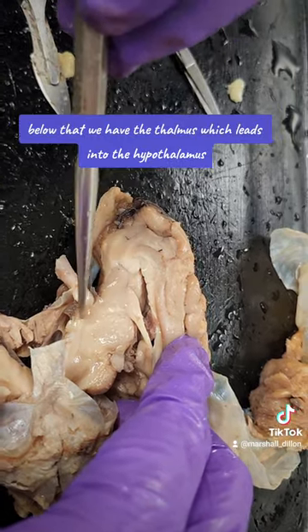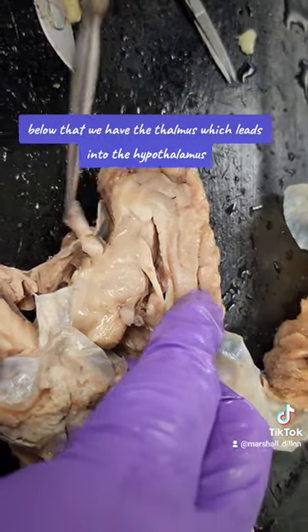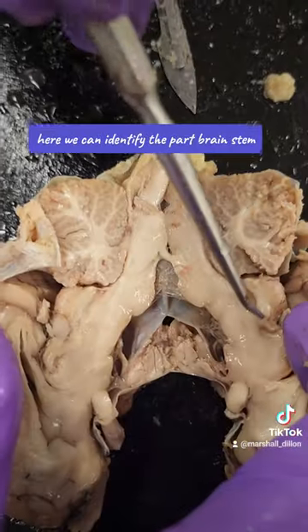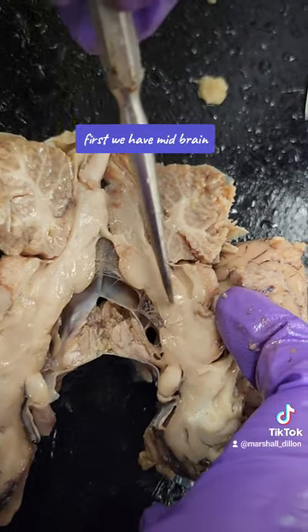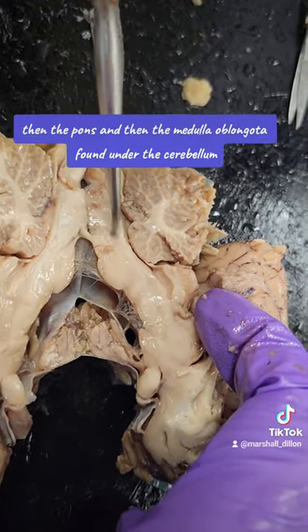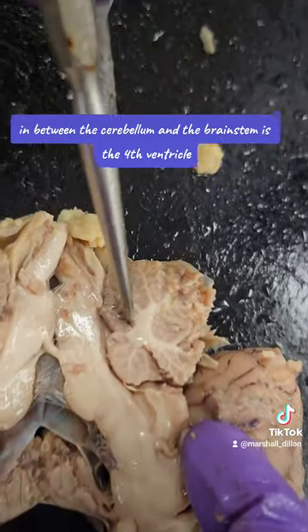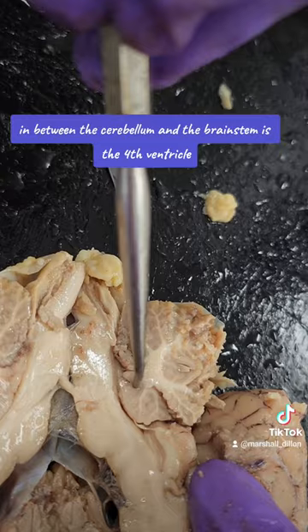Below that, we have the thalamus which leads into the hypothalamus, and then inferiorly you have the pituitary gland. Here we can identify the parts of the brain stem. First we have the midbrain, then the pons, and then the medulla oblongata found under the cerebellum. In between the cerebellum and the brain stem is the fourth ventricle.